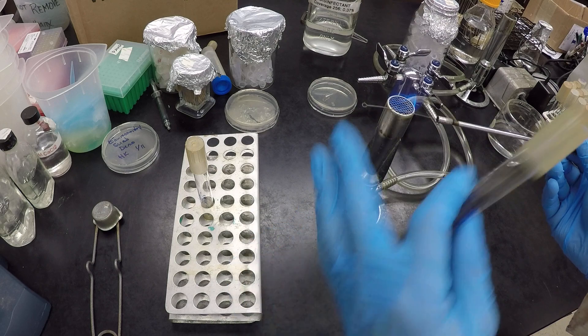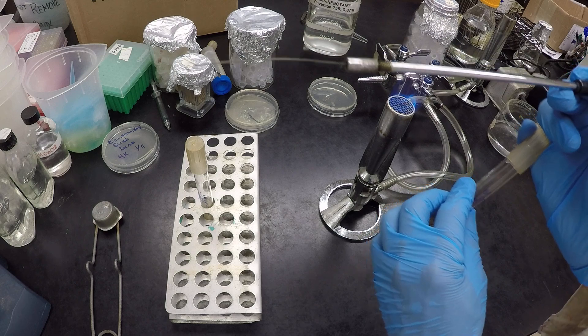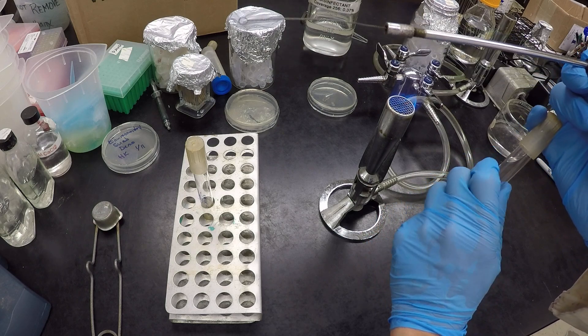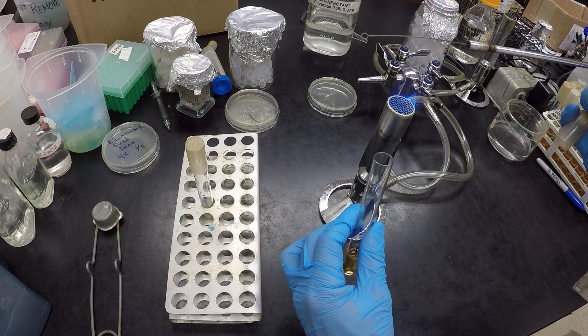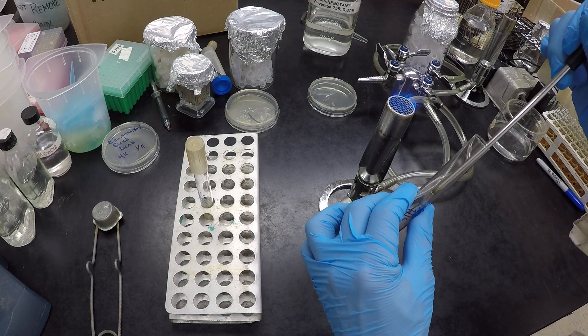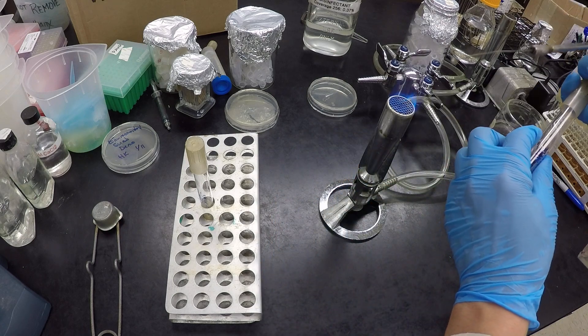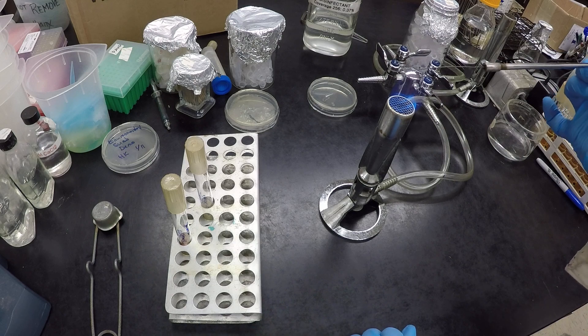So in order to take the cap off, now about 10 seconds, my loop should be nice and cool. Finger on the lid, twist and turn, open up your tube near the flame area, dip it in your broth culture, flame, close, and put away.